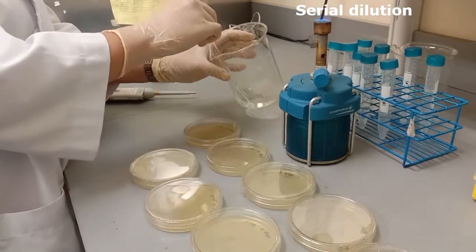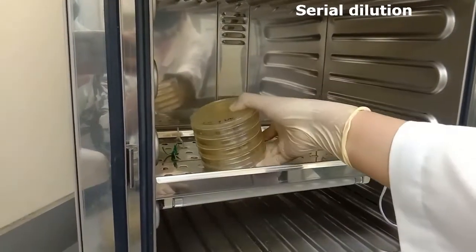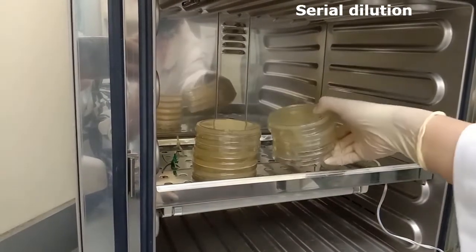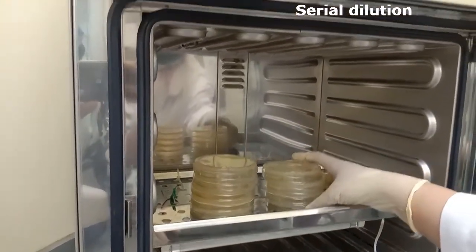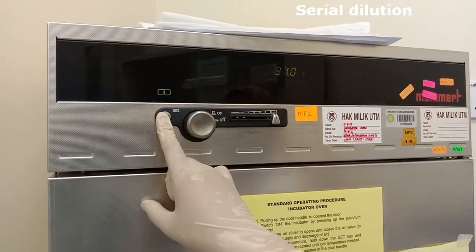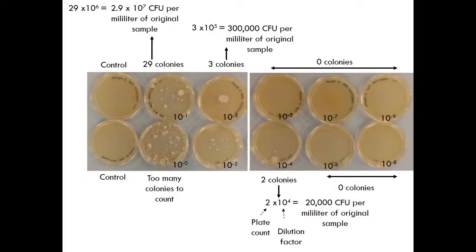The plates are placed in a 37 degrees Celsius oven for 24 hours. And these are the results. The controls are empty plates without samples, whereas the 10 to the power of minus 0 plate was made by directly transferring the samples without making dilution.